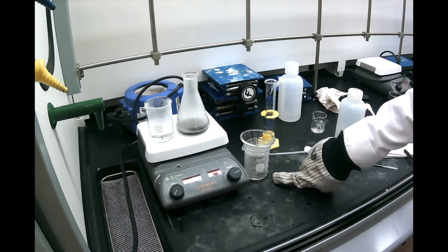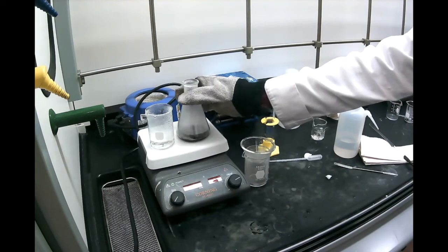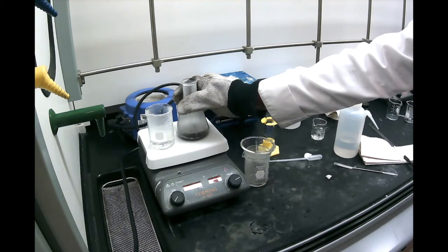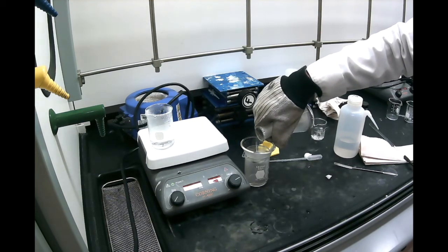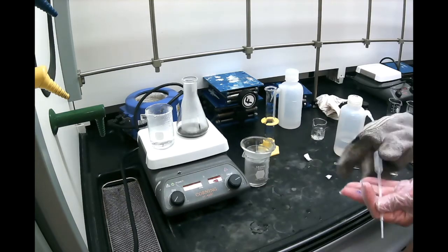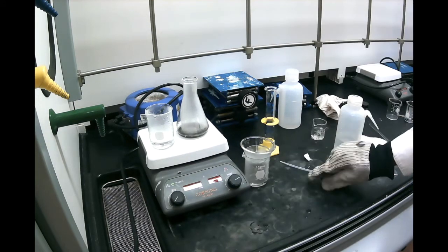But the good news is the liquid in the bottom has absolutely no color. So it shows that the charcoal took care of the colored impurity. And here's one thing, be careful, don't add too much, because again, you don't want to clog the cotton plug. You want to just add a little bit at a time, and you do the filtration. And of course, in the process of going slowly, you will lose some of the solvent. So that's why it's always a good idea to have some hot water on the side to add the solvent that is lost by evaporation.